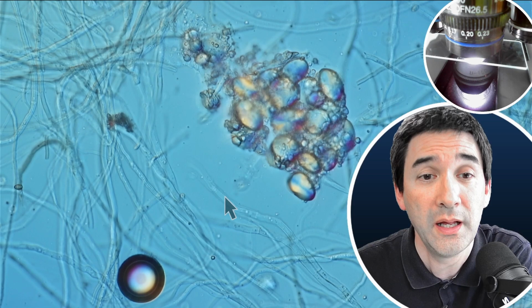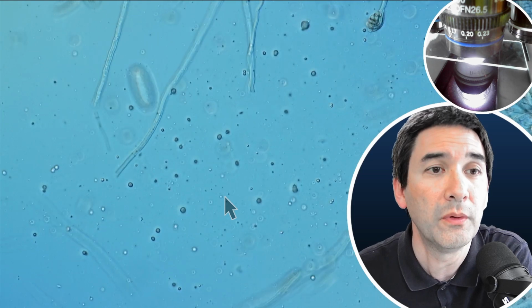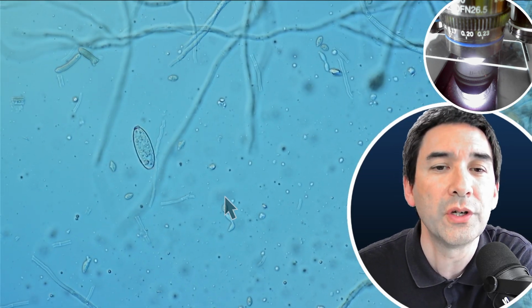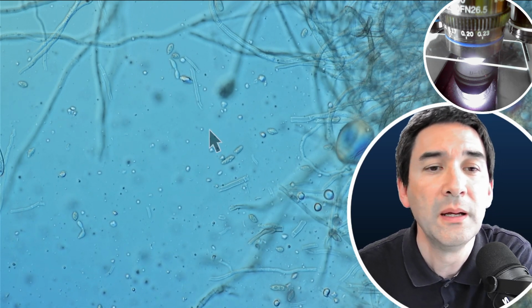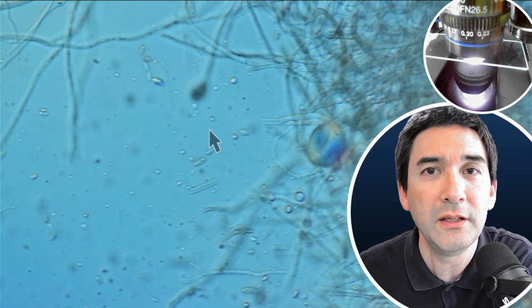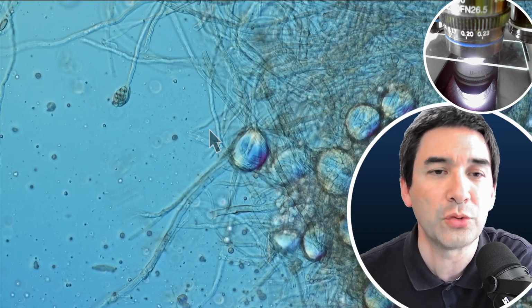Okay, so maybe that's an air bubble, this round thing here. So maybe I did take something from the bread itself. Look, it's also an interesting oval structure here, and these things here in the background look a little bit more like spores. But as you can see, there are plenty of things to discover. But also considering the coloration and the way, these are definitely starch grains.